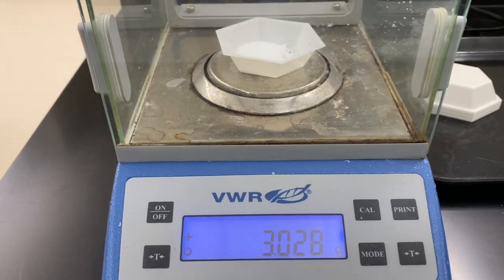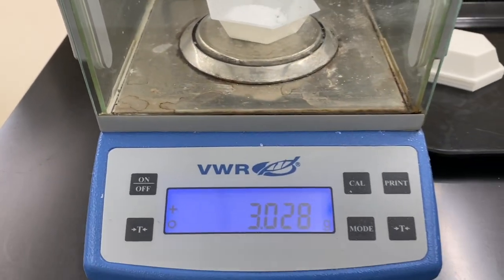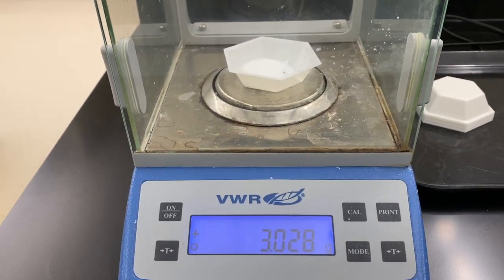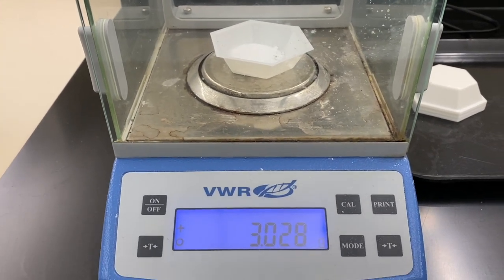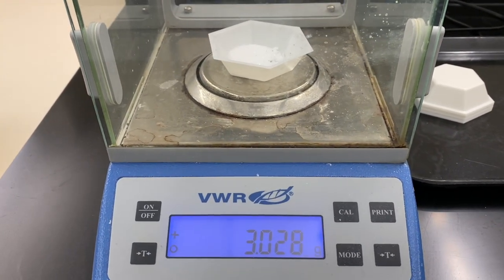All right, so we have our nice white shiny crystals. And I've tared the weigh boat already. So this is just simply the mass of the product.